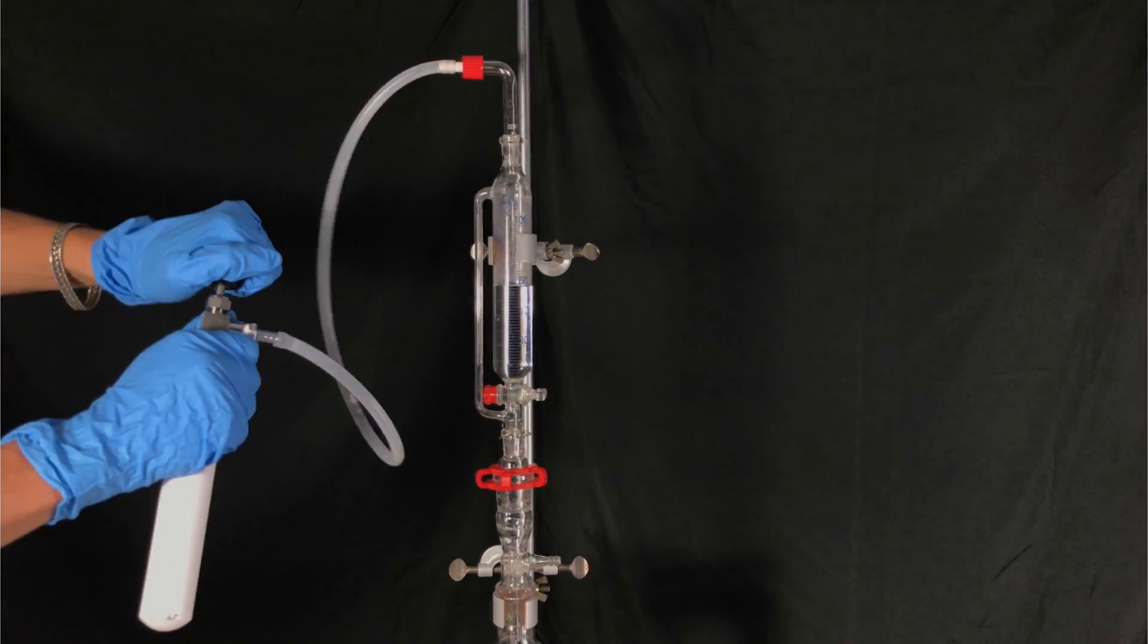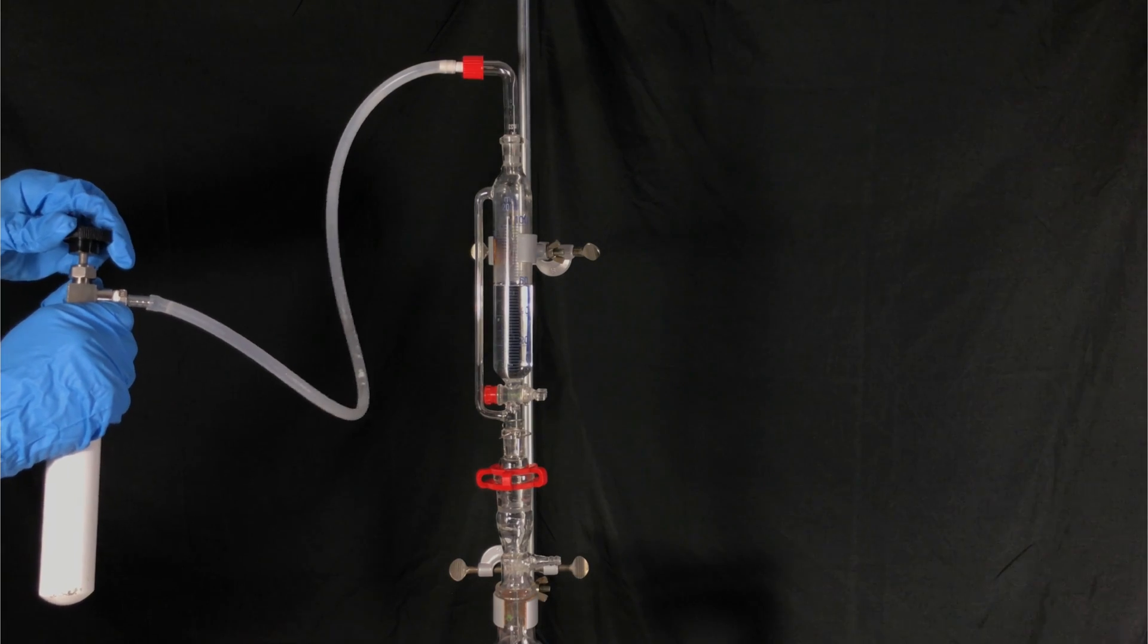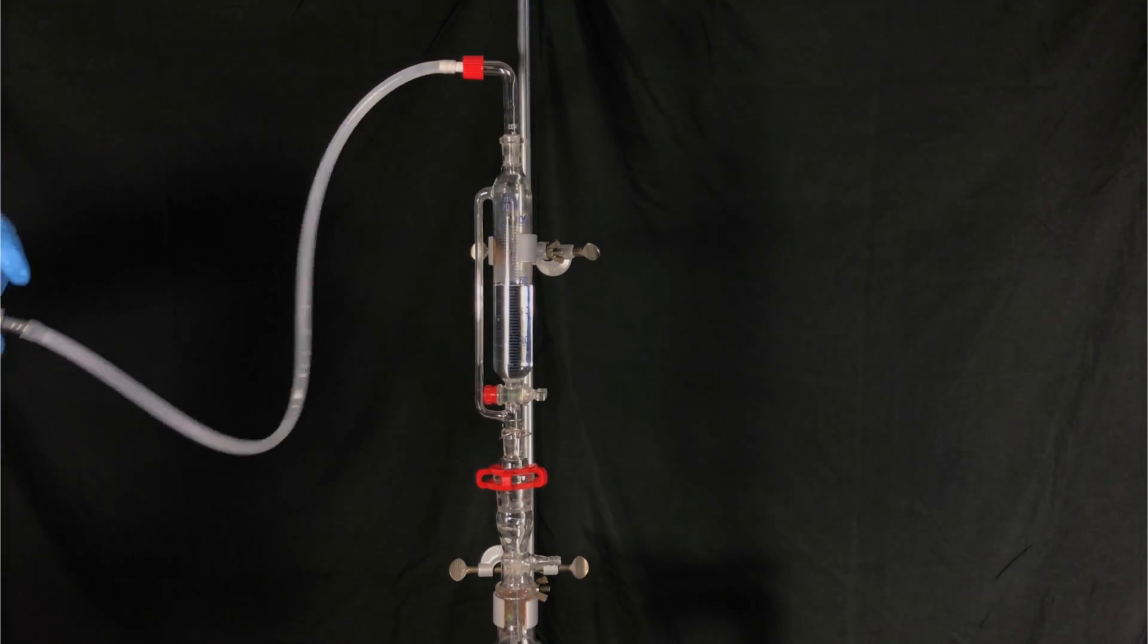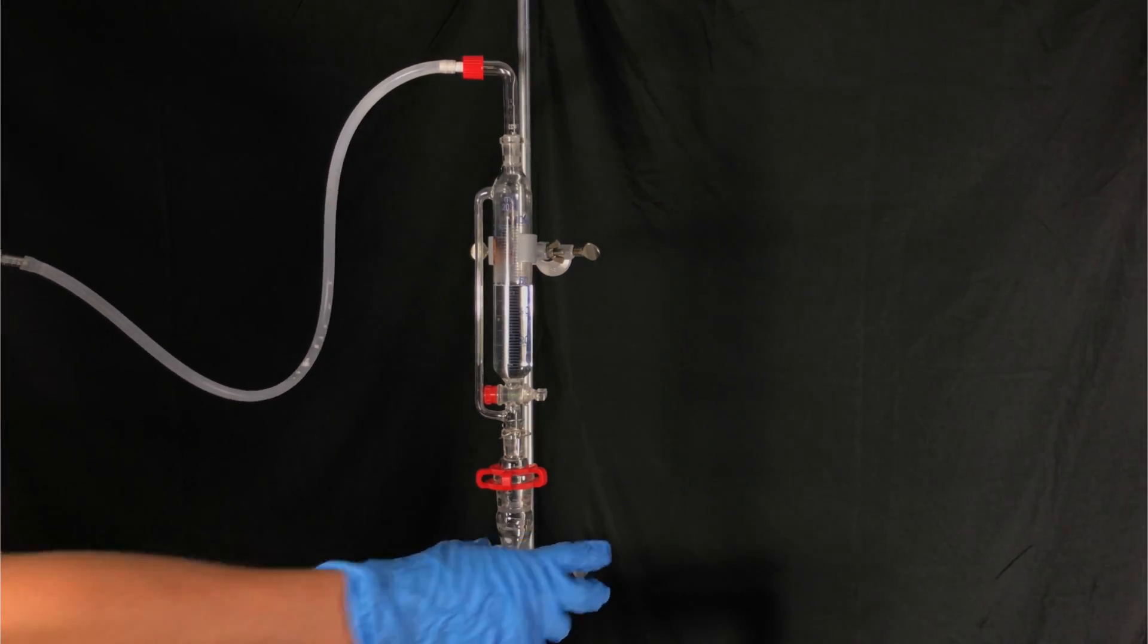An inert gas like nitrogen or argon would probably be better suitable. But as I don't have any inert gas on hand right now, we are just improvising and using butane.